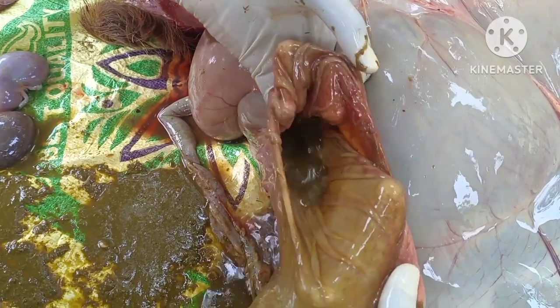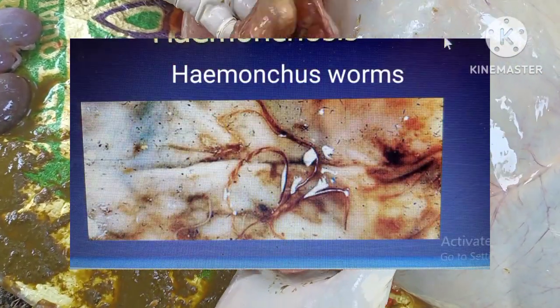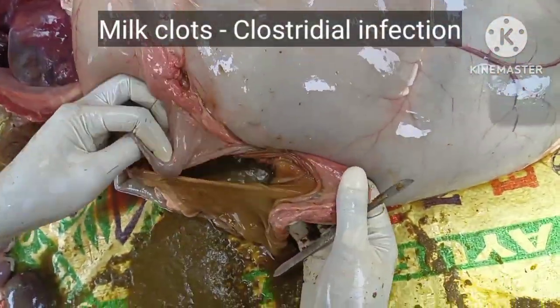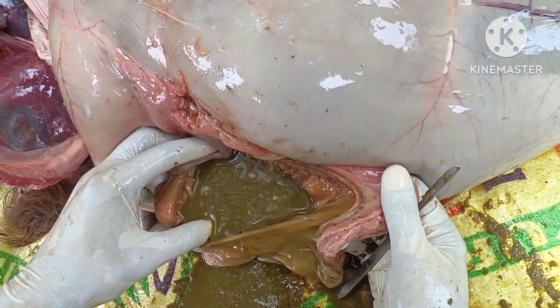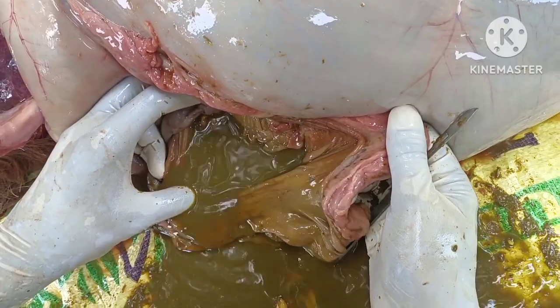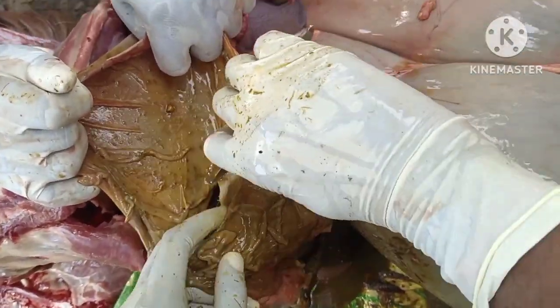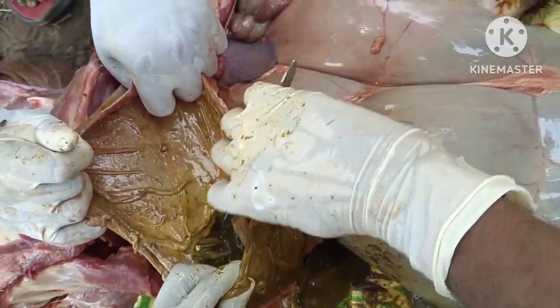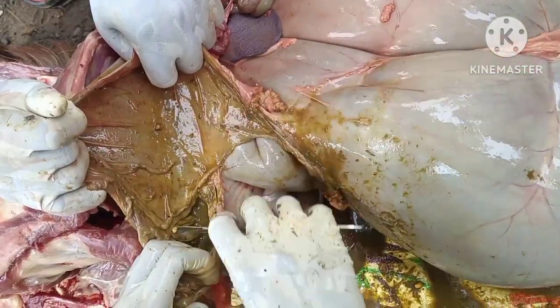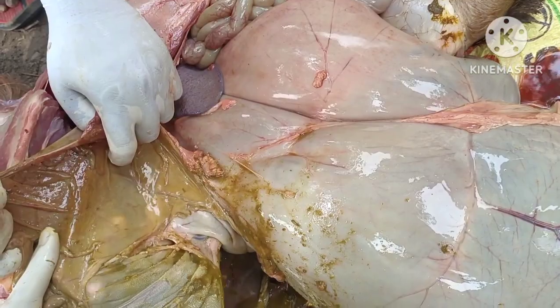And if we pour some water, then we can observe if there are any Haemonchus worms, that is the thread-like worms, red and white color thread-like worms on the mucosa of the abomasum. And if there are any milk clots in the abomasum, that indicates the clostridial infection. This we can see mostly in case of lambs. And if we go through the abomasum, we can enter into the omasum, where the leaf-like mucosal folds we can see there in the omasum.